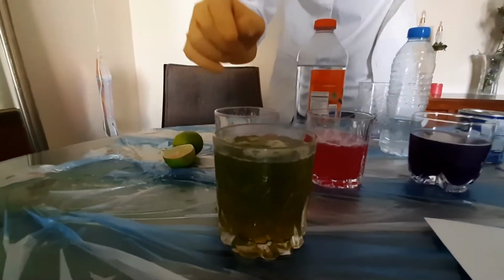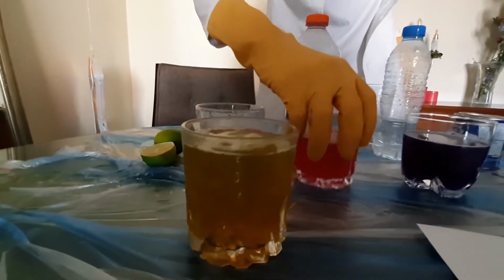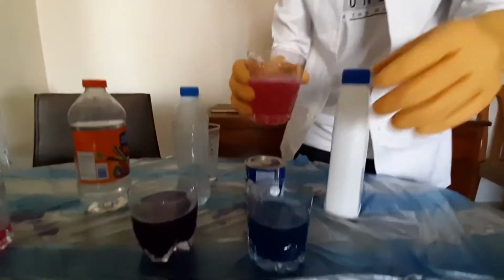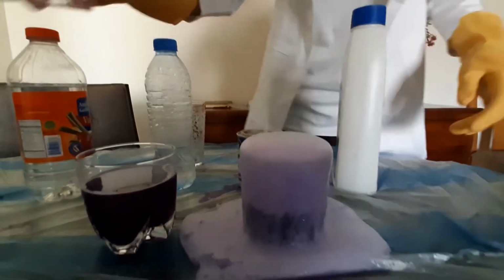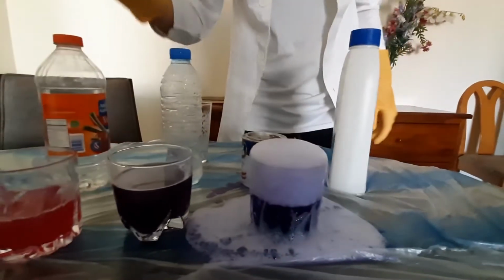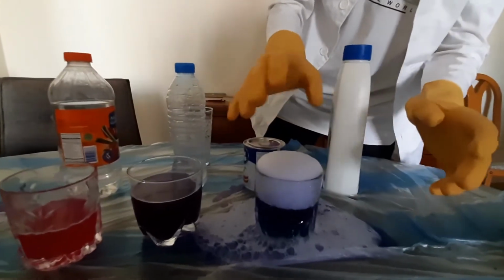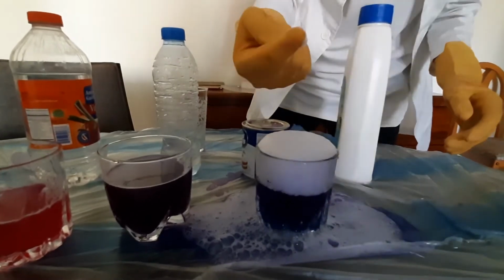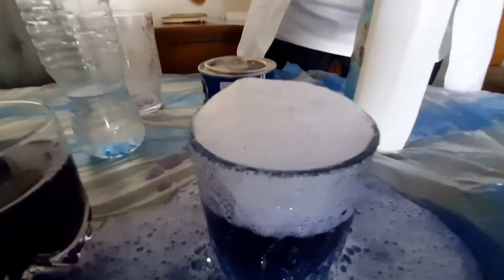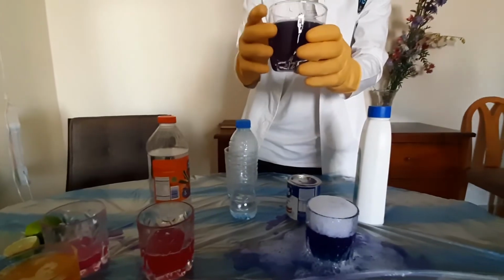See that it changed to a green color because this is a very strong alkaline. It doesn't really affect it as much. However, let's take this solution and this solution right here. You would see that it created a carbon dioxide reaction. After it creates a carbon dioxide reaction, it turns into a normal color, which is almost blue because this is still a strong alkaline. This is carbon dioxide gas because of the foam that occurs between the reactions.